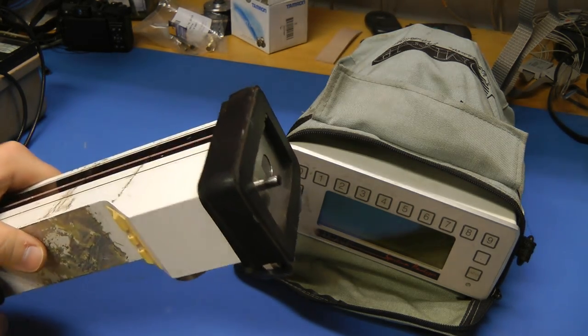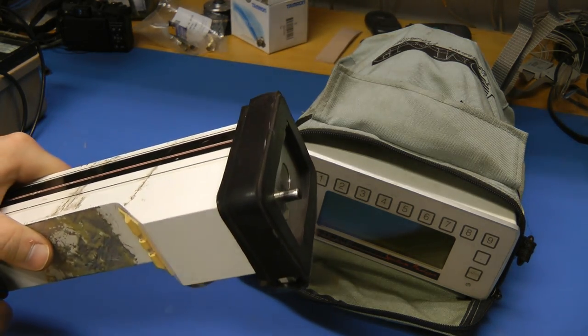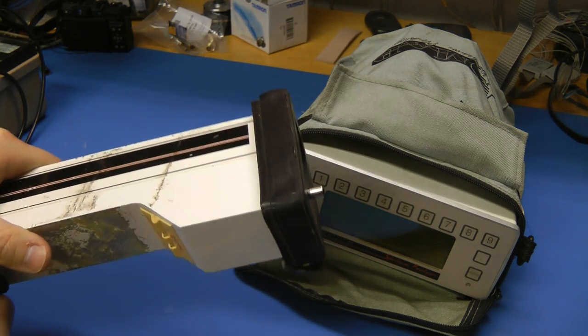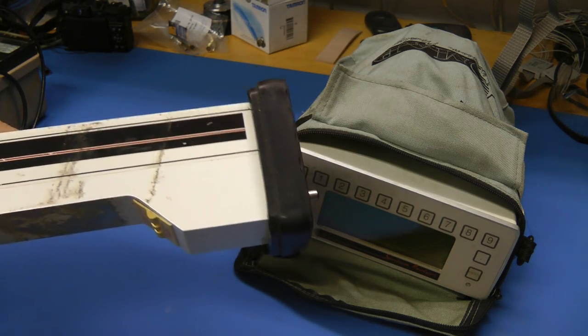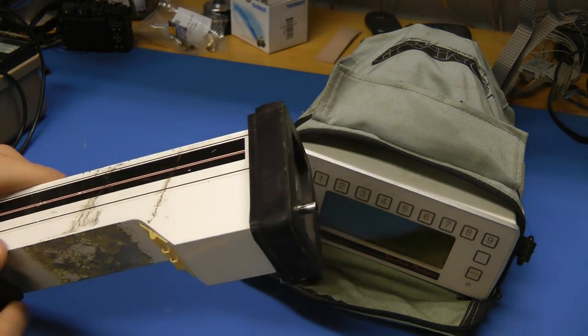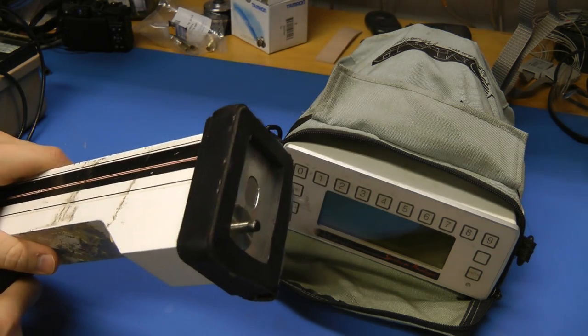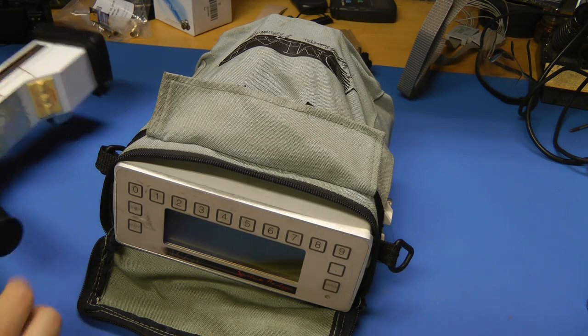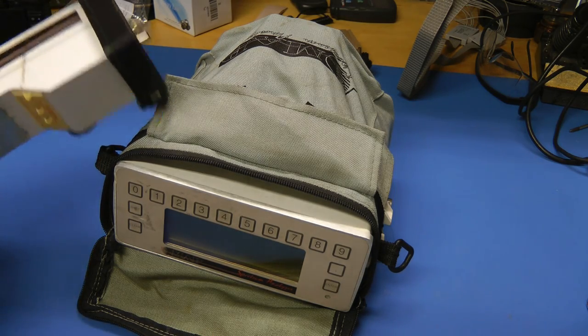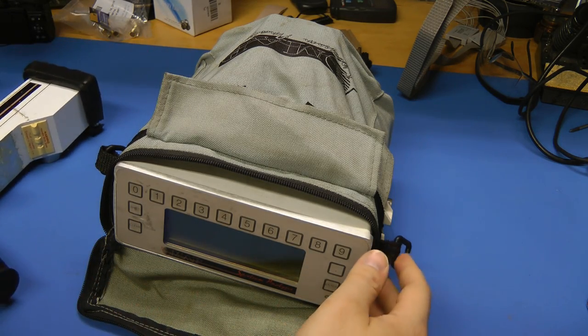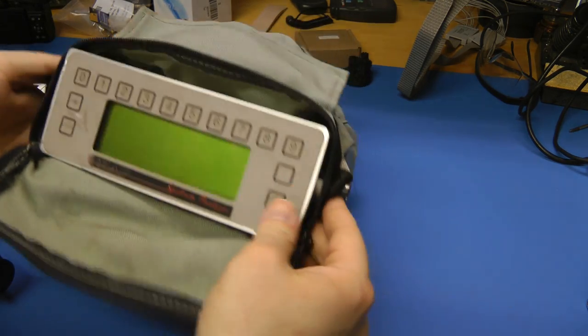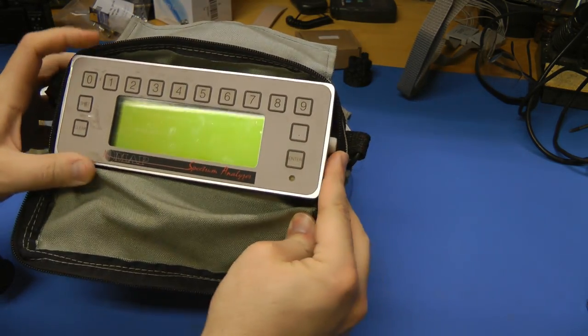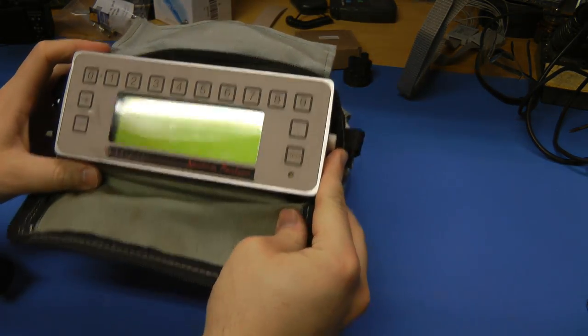And there's also not a small amount in this. Apparently, from the documentation, this has 40 millicuries in it, which is 40,000 times the amount in a modern smoke detector. So this unit consists of the detector head, as well as this module that it plugs into that gives you a display.